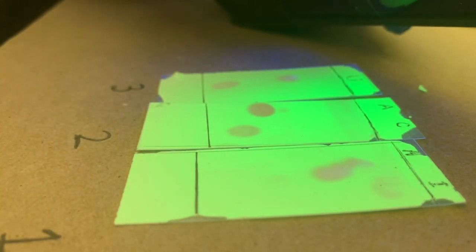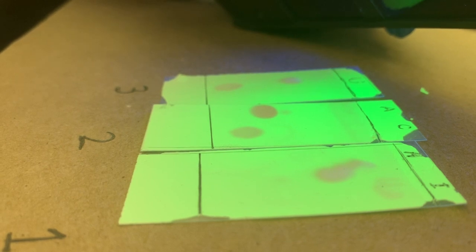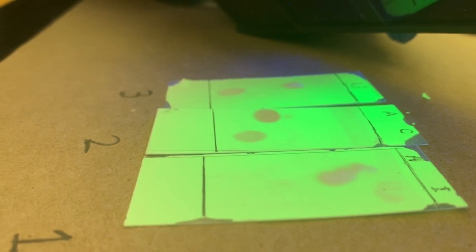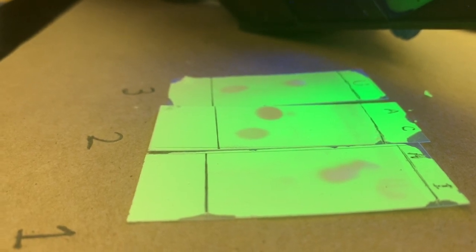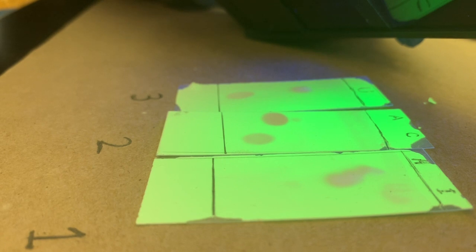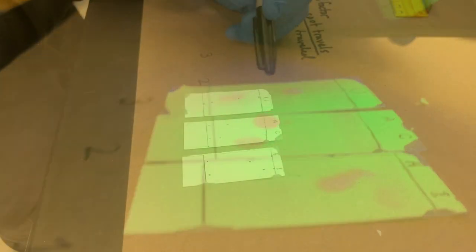So between all of these different compounds, another thing worth noting is the polarity. You can see that some of these compounds are a little bit more polar than the others, and they stayed either closer or further from the end. What do you think? If you guessed that the more polar ones stay closer to the starting line, you were correct. The eluent swept away the more nonpolar compounds and took them to the end of the TLC plate. All right, let's get to calculating some RF values.